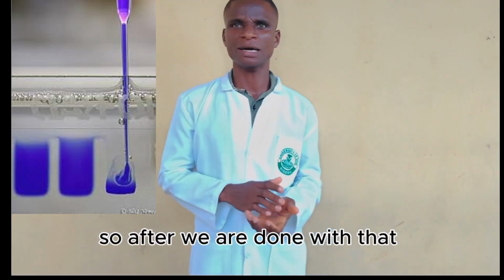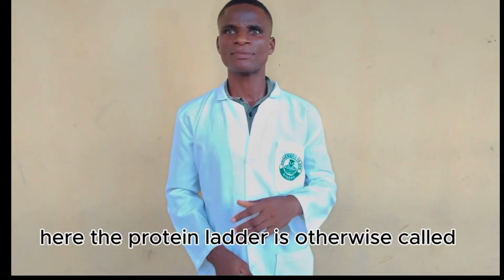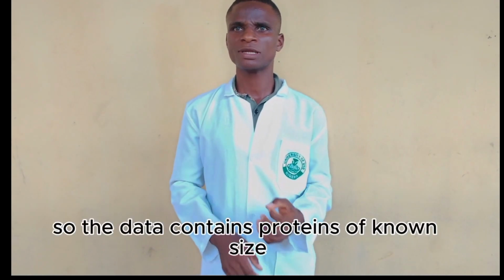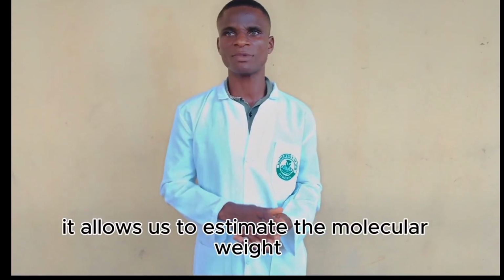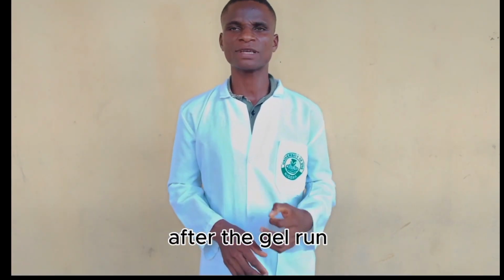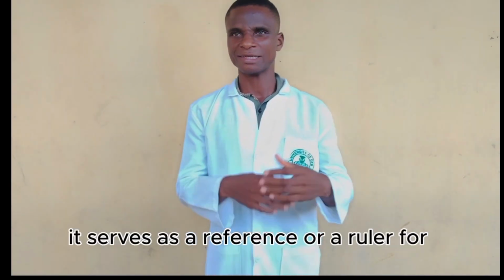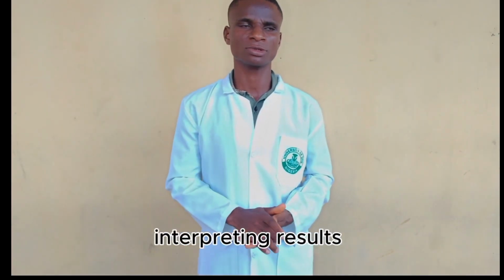So after we are done with that, we now add the protein ladder. Here, the protein ladder is otherwise called a molecular weight marker. So the ladder contains proteins of known size. It allows us to estimate the molecular weight of the proteins in our sample after the gel run. It serves as a reference or a ruler for interpreting results.